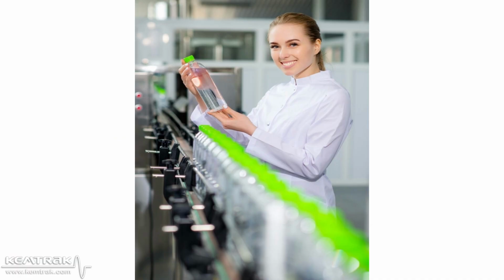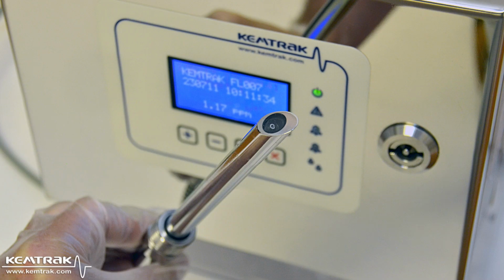By continuously monitoring the product for any signs of ethylene glycol contamination, Kemtrak photometers help protect your brand, minimize product loss, and reduce costs by identifying leaks at their source. So which technique are you going to buy if you can get an analyzer that is 100 million times more sensitive to leaks for the same price point?